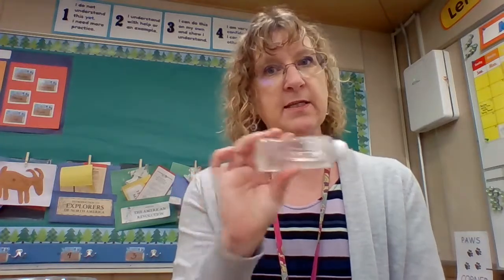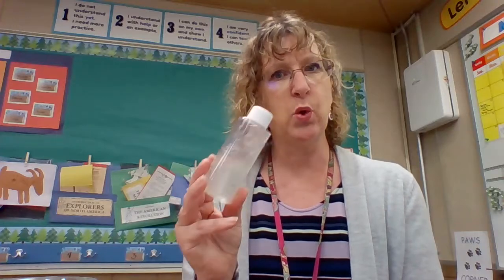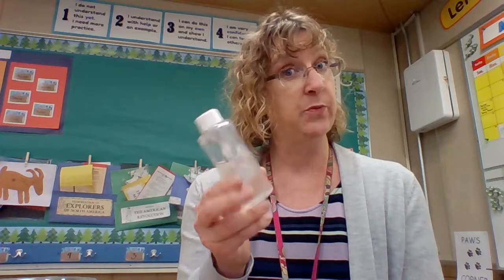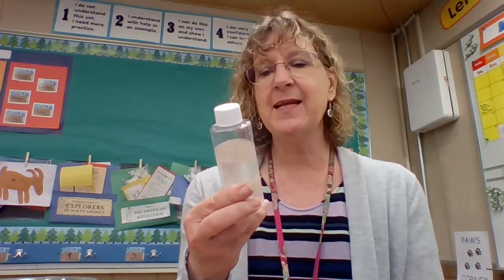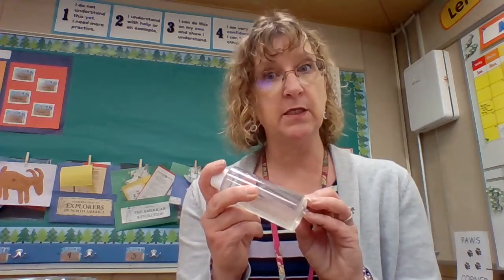And as I shake this and as I hold it, this water is a little bit chilly. It's getting colder. I don't know if that's because of the substance. Could be. So now I have reached saturation, and I need to filter out the remaining solute, because I only want to measure how much of the solute actually went and dissolved into the water, right?